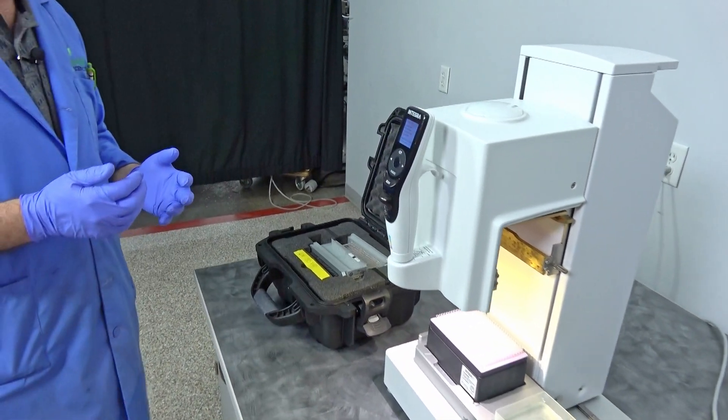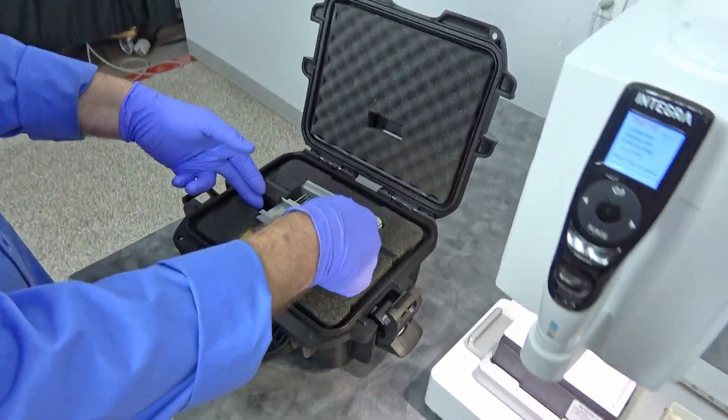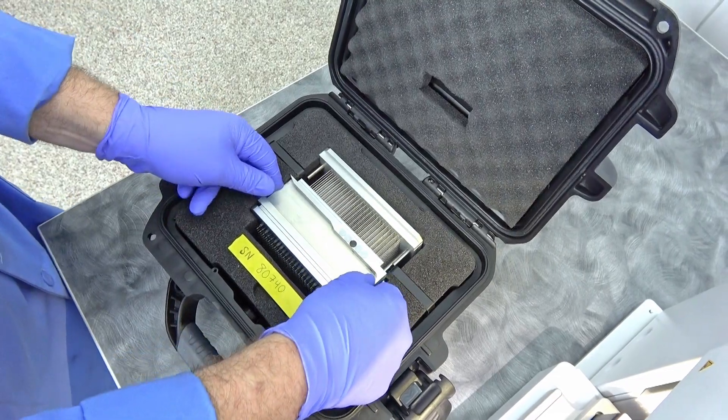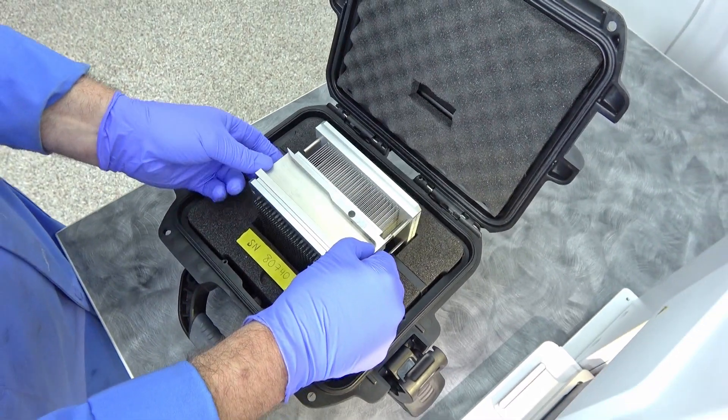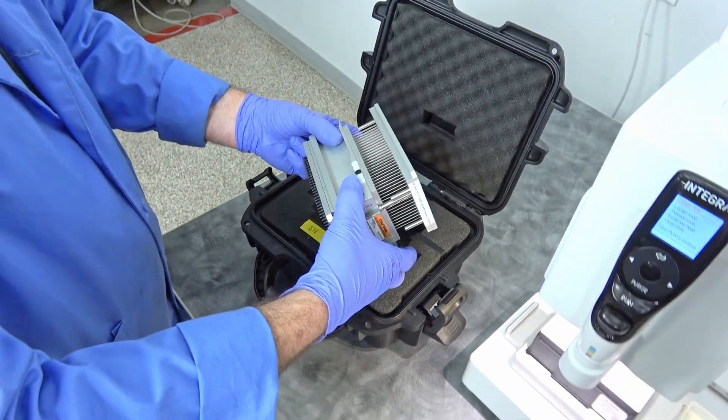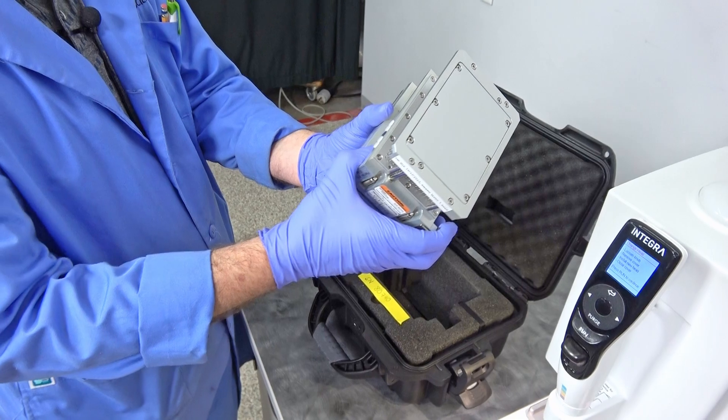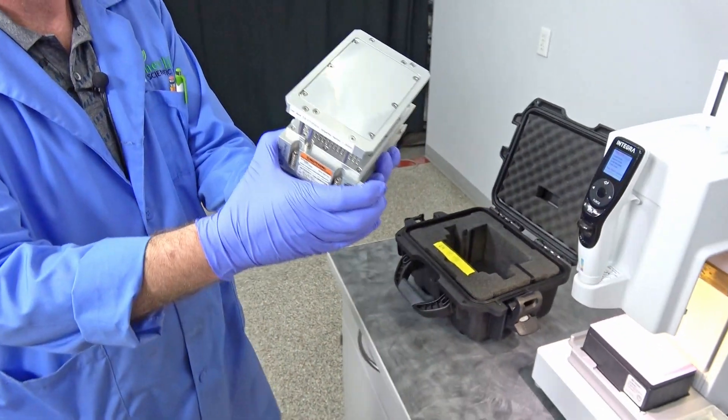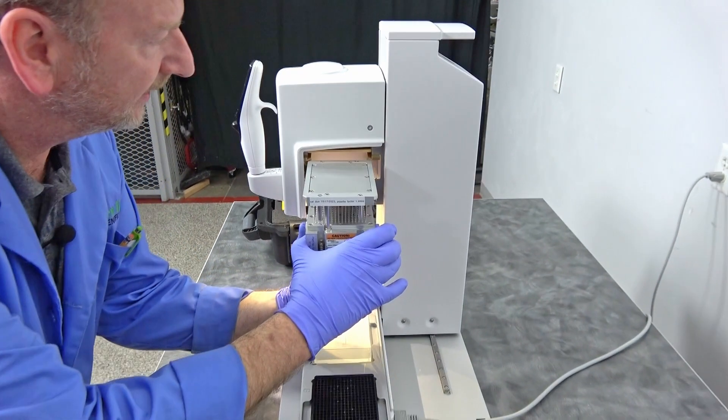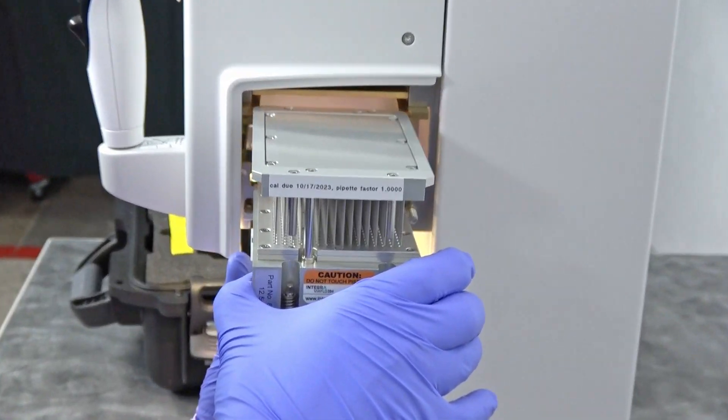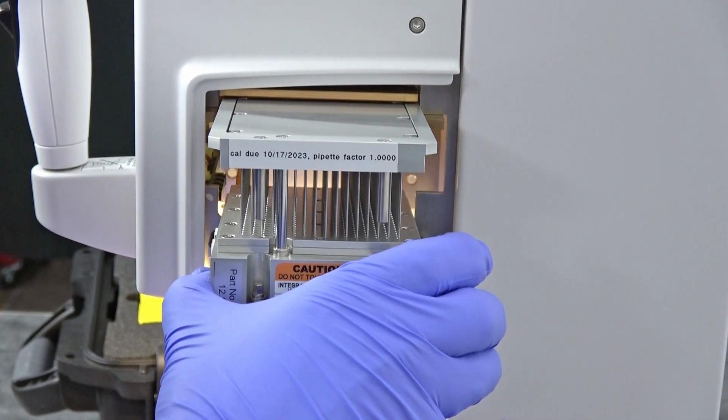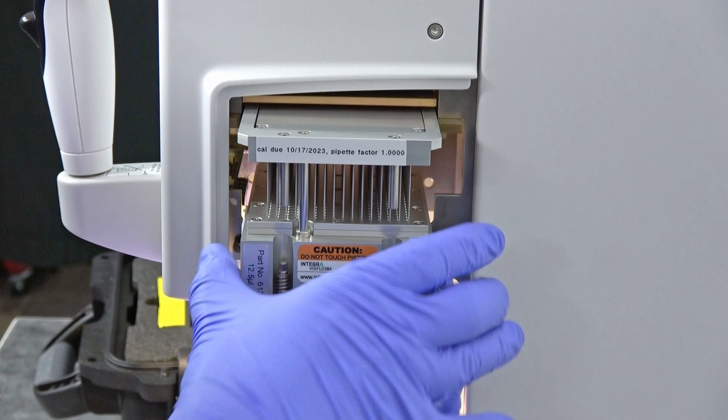But it's very fragile heads, I mean you got to be very careful with these. So it does have some finger inserts here that you're going to just reach down and grab this and pull it out. I'm going to get a hold of the underneath with this hand, but I'm not wanting to touch any of the syringe type moving parts. And you can see it's got a channel at the top and it's got a channel on the sides there, so it just simply slides right in there. Just being careful you're installing that, push it in.